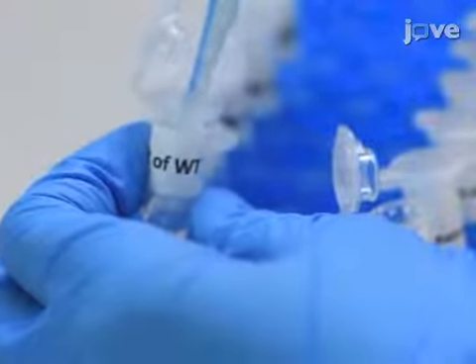Transfer the top 1,000 microliters of the supernatant into a fresh 1.5 milliliter centrifuge tube.